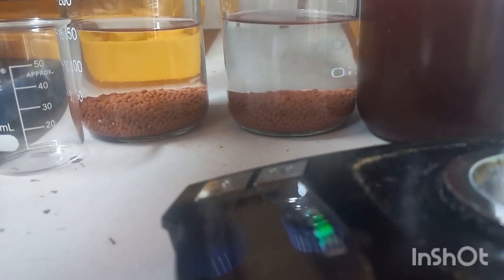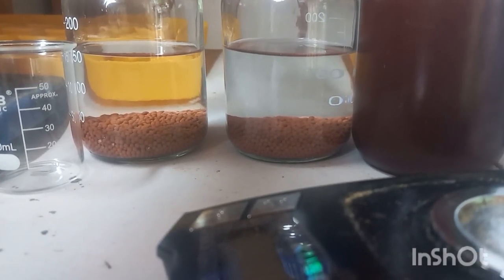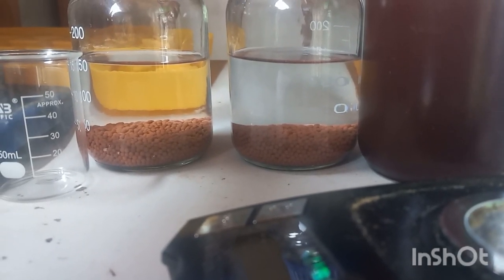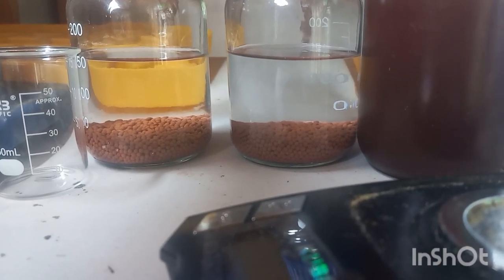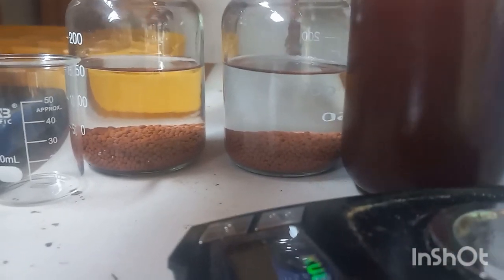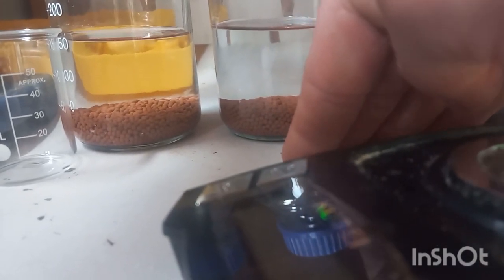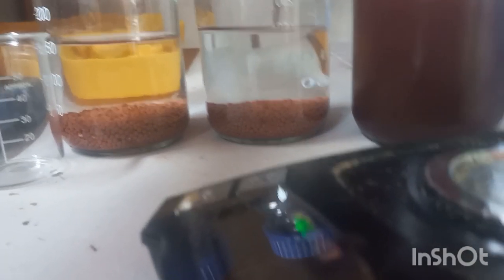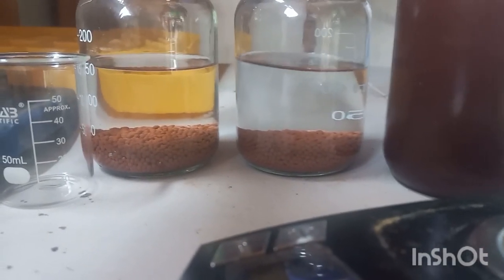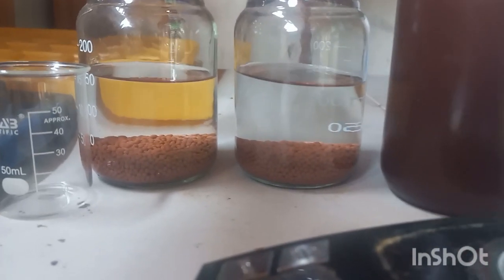I'm only using about half of what I should, but according to the paper I'm going off of, they had a 10 times molar excess. That's probably good. I'll probably top it off with some more methanol, because what I'm going to do is take the propylene carbonate, throw it in here, and these molecular sieves I went way overboard with. There was hardly any water in that methanol. So I'm going to dump everything in here, top it with a little methanol, propylene carbonate, and let it all dehydrate as much as possible overnight.